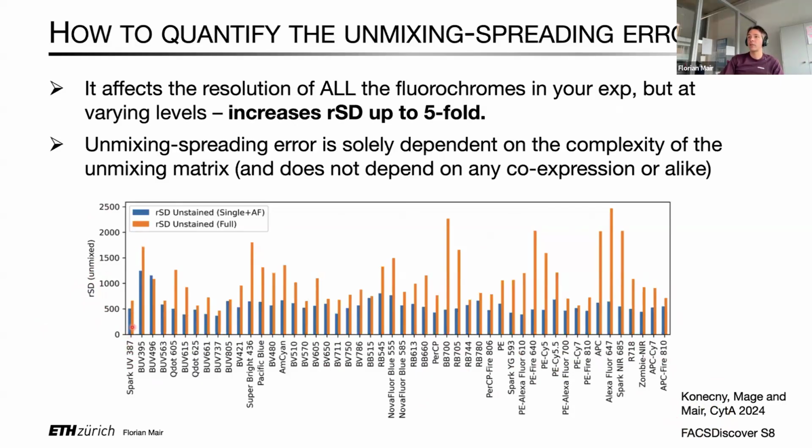And in orange, you can see the RSD of unstained cells when a full 50-color unmixing matrix is applied to them. And as you can see, there are some fluorochromes where not much is happening, and some fluorochrome neighborhoods, like, for example, here, Brilliant Blue 700, or here, the APC, Alexa 647, Spark NIR 685 neighborhood, where you can have up to a 5-fold increase in the RSD of the negatives.